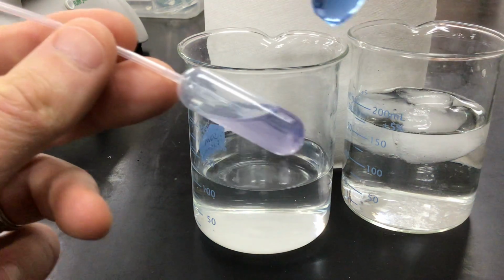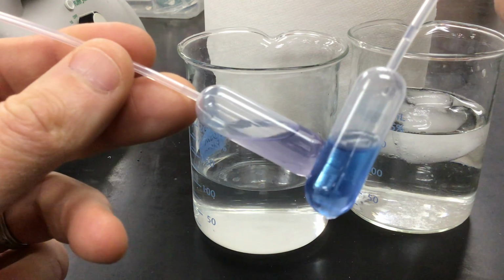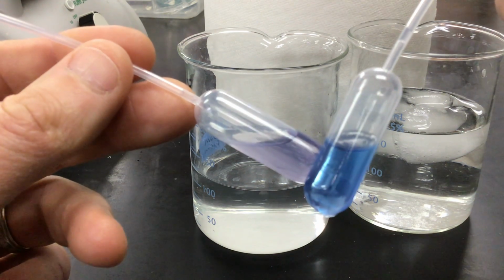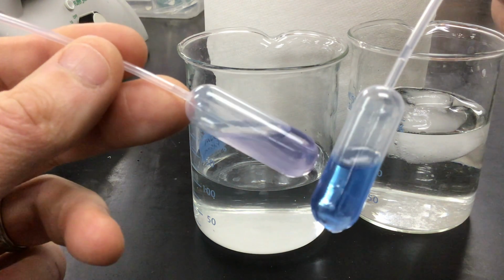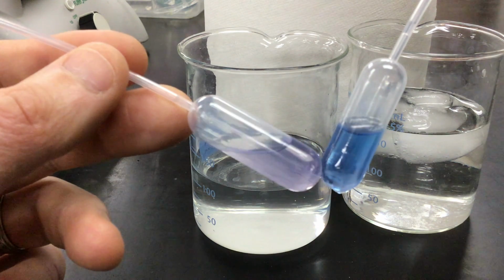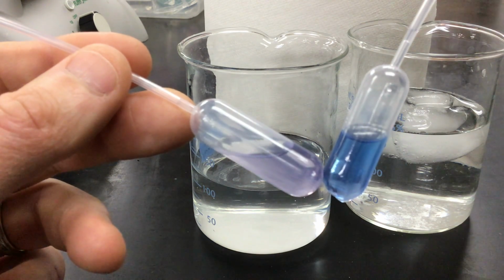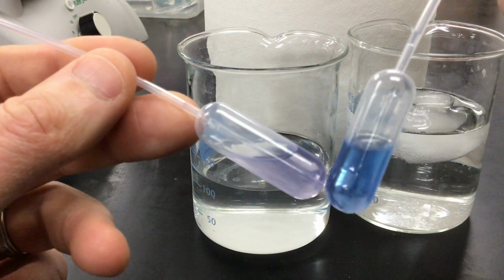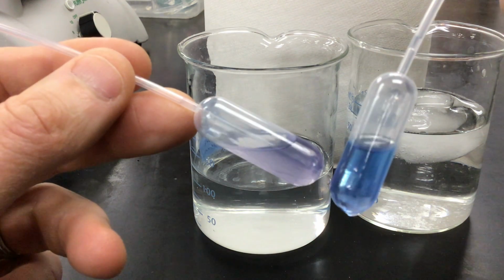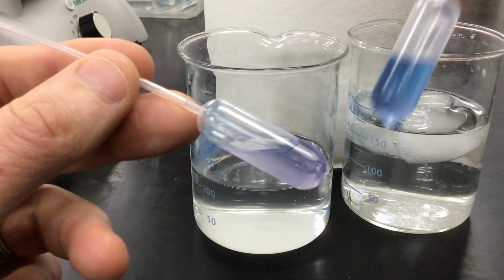In putting it in heat, you can quickly see the color change that has occurred in it. So please make note of that in the data table. Placing the sealed barrel pipette into the hot water causes the following chemical change. The reaction is either going to shift left or right. Look at the chemical equation given, and very quickly by the color change you should be able to indicate which direction it is shifting. That'll also tell you if this equilibrium reaction is either endothermic or exothermic.